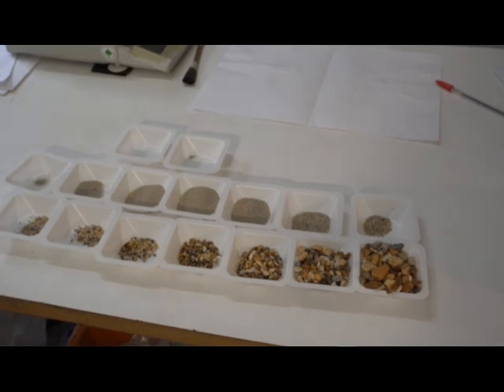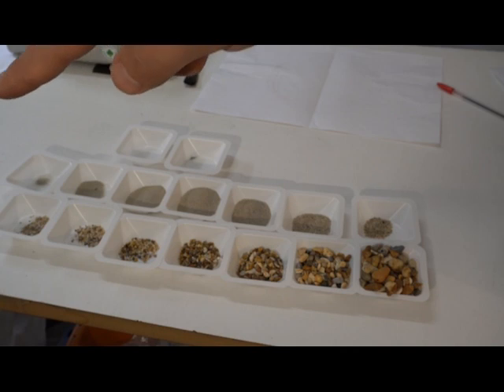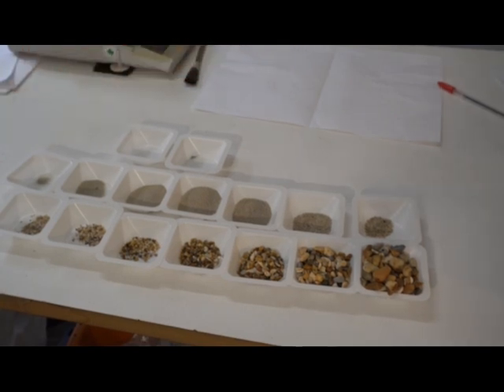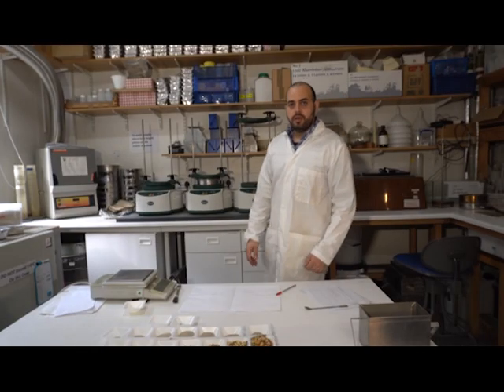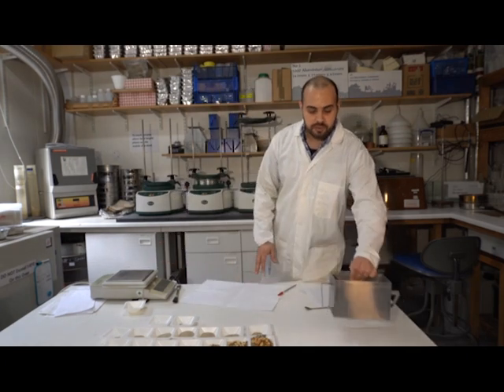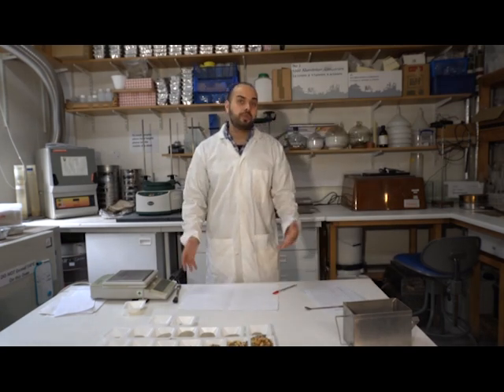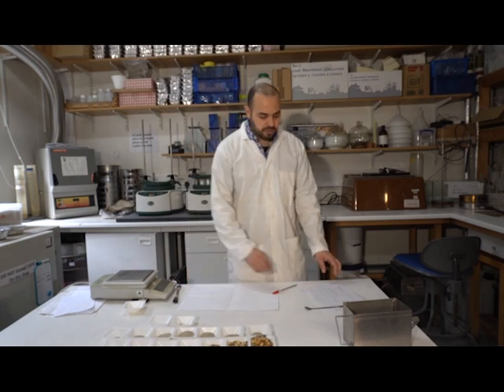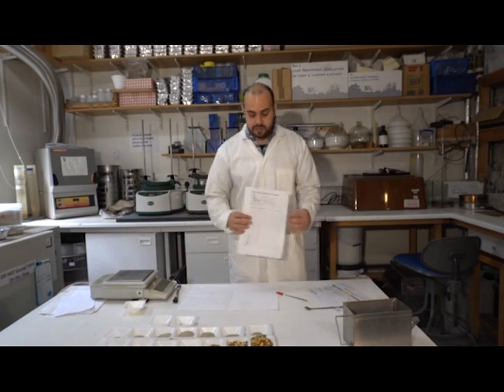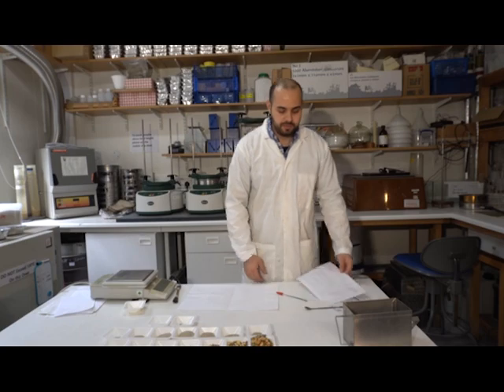Our sediment has been sieved now and divided into half-phi scales, going all the way from 8 millimeters in here all the way to sand size just around there, and then finer material at the end. So here we have it. We just finished the first replicate. I will do the same again for the next replicate. Usually you do about 3 or 4 replicates per site, so you can quantify the errors. Another thing I have to do is digitize this and use software to plot the data, or do it manually if you want to. I'll show you.